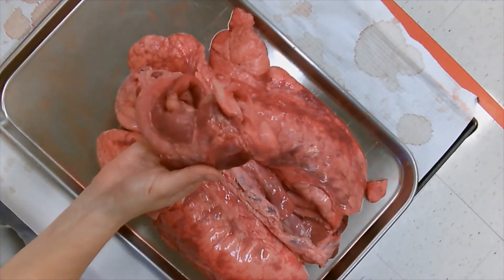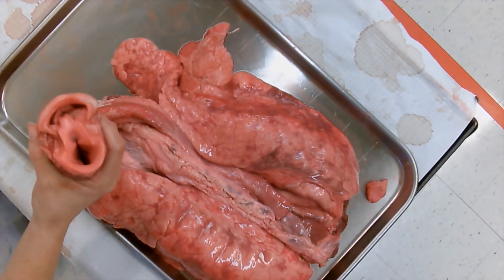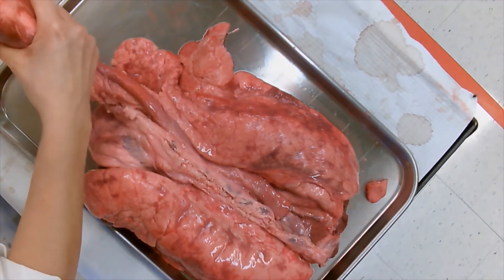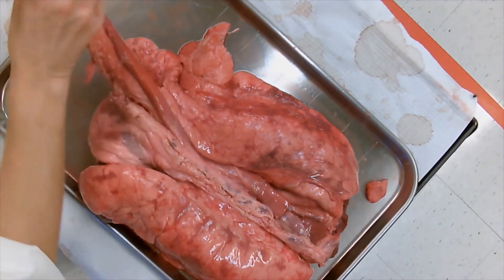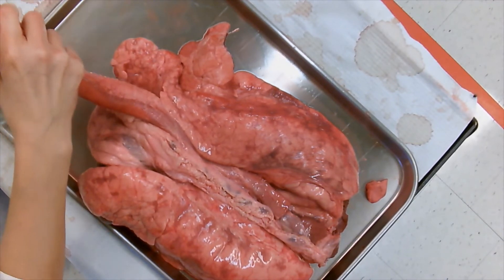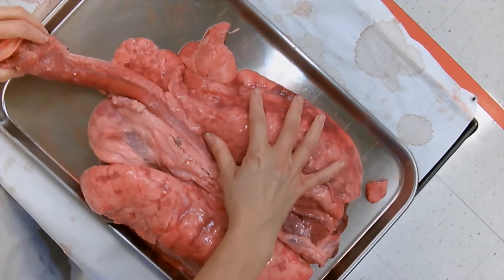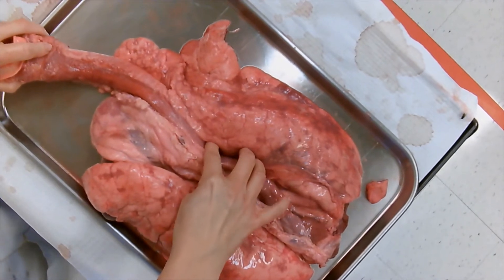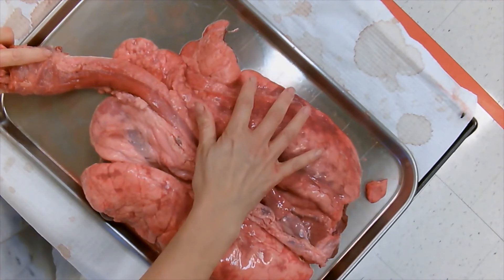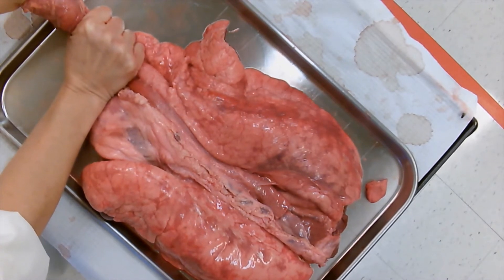If you ever go to the hospital and can't breathe properly, they have to intubate you. They have a metal tool that opens up your mouth and then they put a tube in. Right now I'm putting the tube in and it's going really far down. The tube is all the way inside — I think it slid into one of the bronchi, so this one should actually inflate.